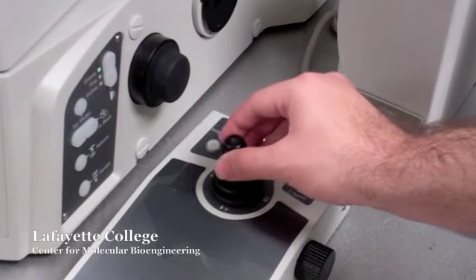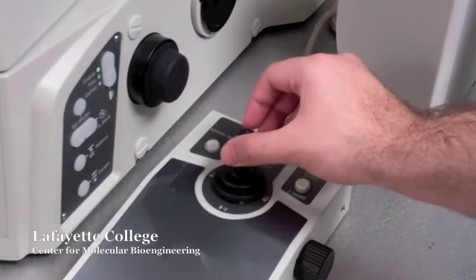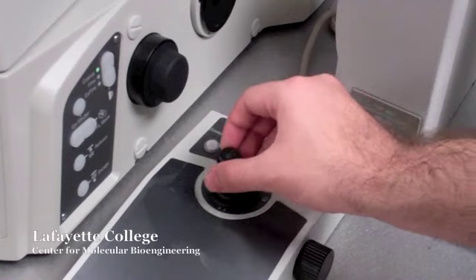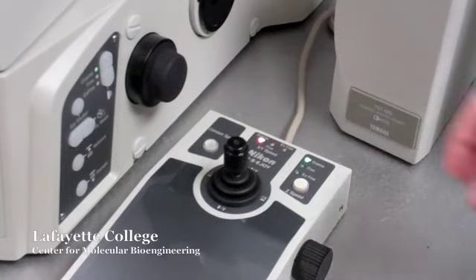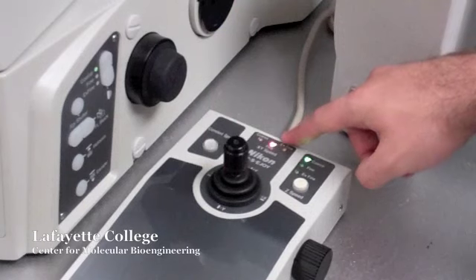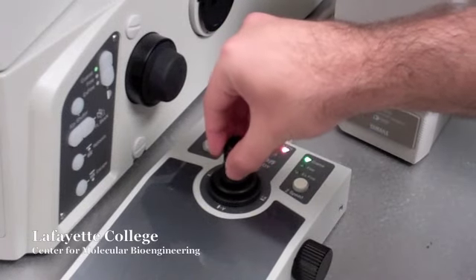The stage can be laterally positioned in the X and Y directions using the joystick. You can also twist the joystick to adjust between coarse, fine, and extra fine motion.